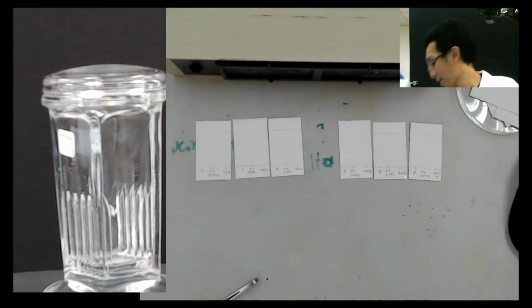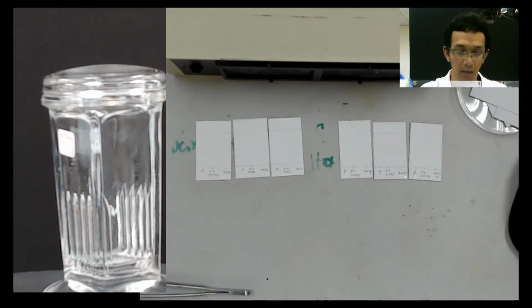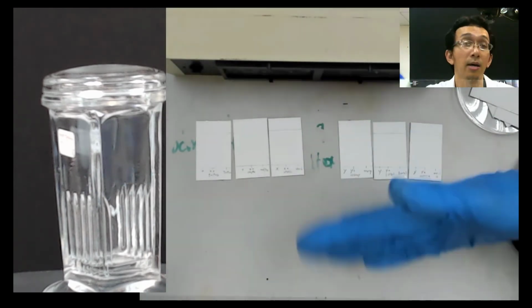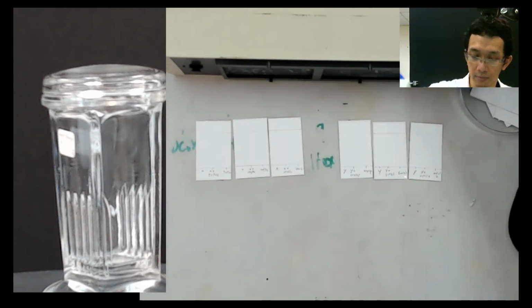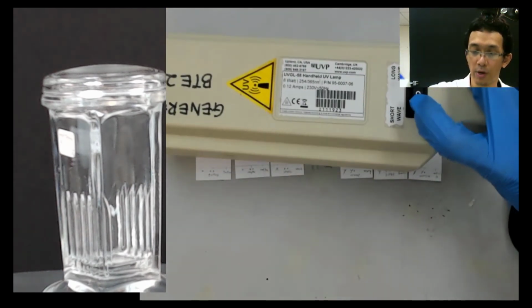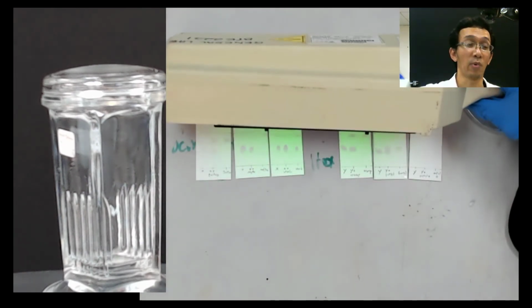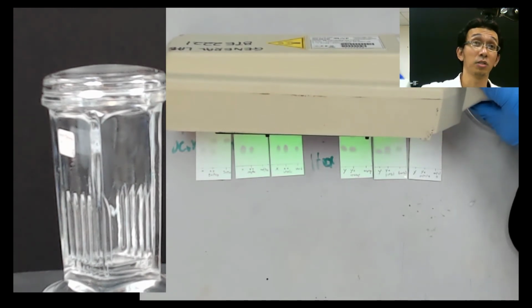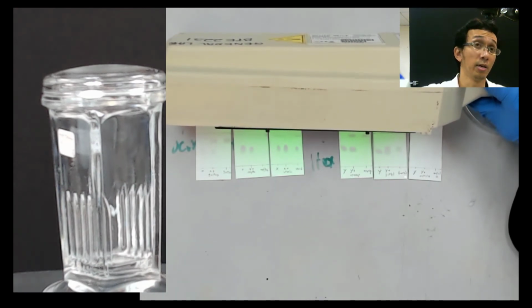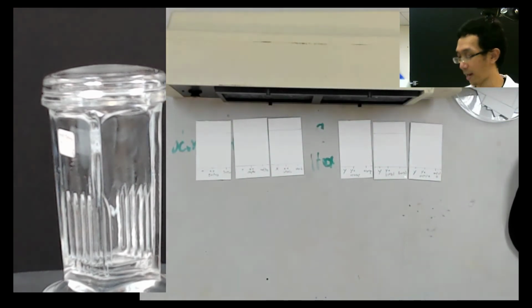For example, where is my plastic? Yeah, this plastic. If I put this plastic in front of me, it will block the UV. So now, if I open the UV, the short wave, you can see something. You see the green one, right? But it's not clear, because I need to close the light first. So let me switch off the light first, and then later I will change to the camcorder view.